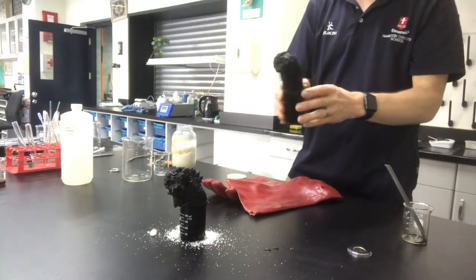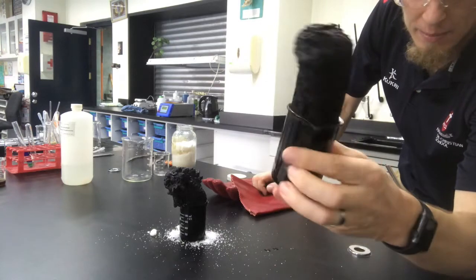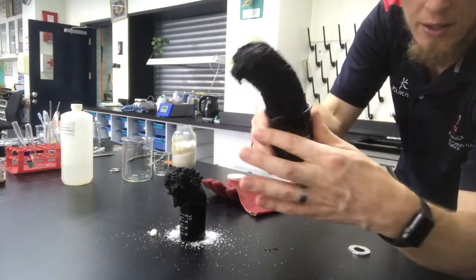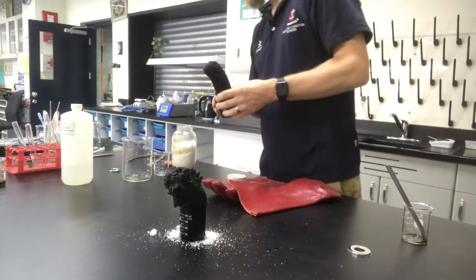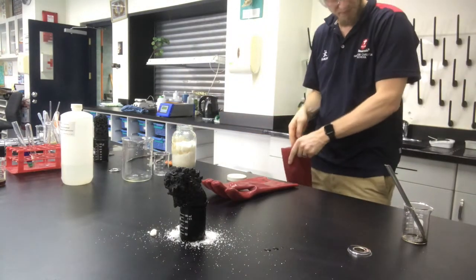Don't breathe in those fumes, there's a bit of acid in there as well. But yeah, that's quite cool, and that's solid. It's quite hard to see on camera, but there's lots of air bubbles and stuff in there. Okay, I'm just going to put on my gloves. Whew.